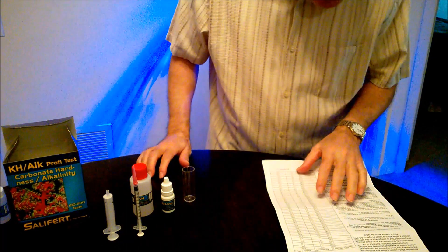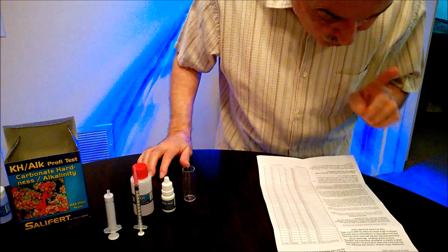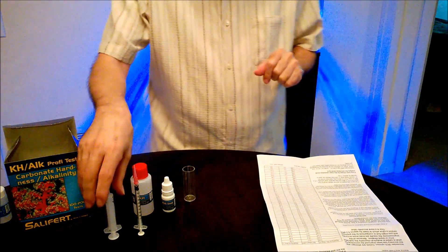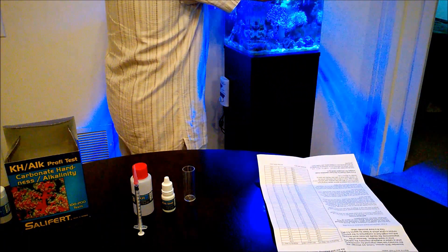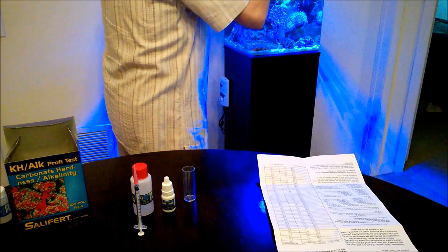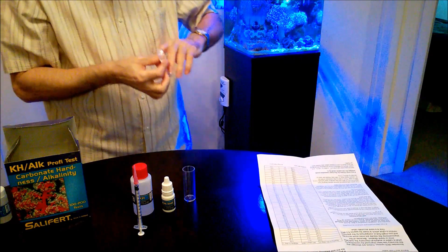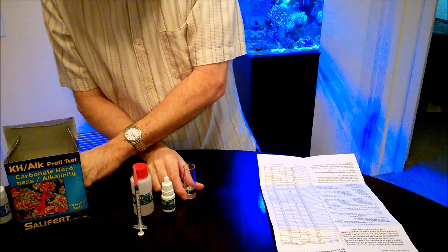So, first step, it says add with the 5ml syringe 4ml of water to the vial. So we're going to go ahead and do that. Okay, here we are. Let's put this aside.